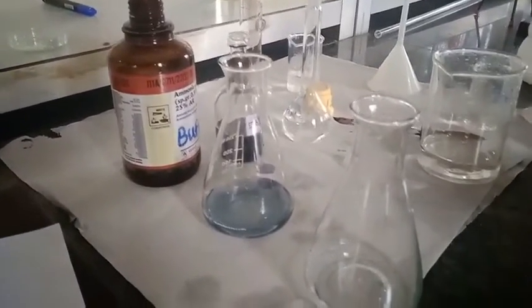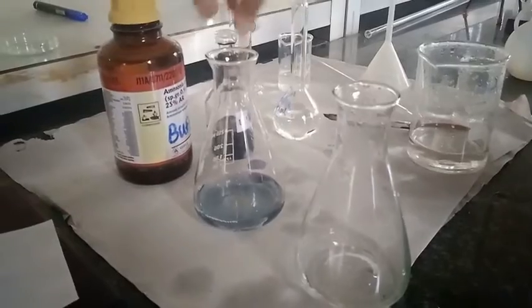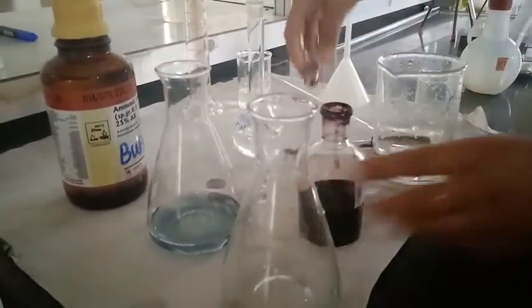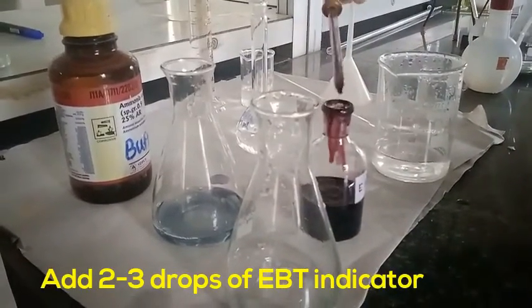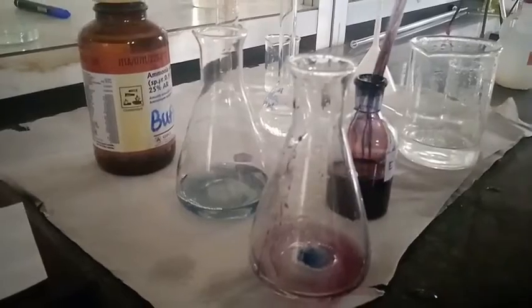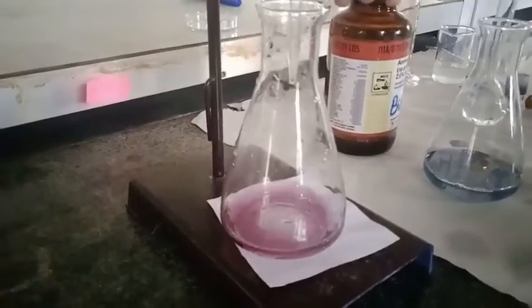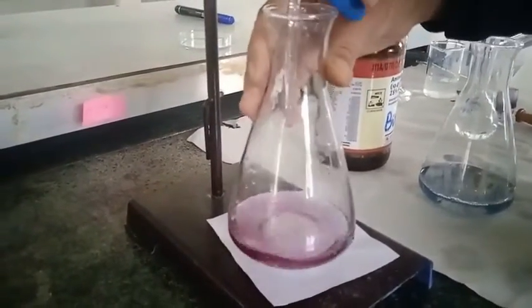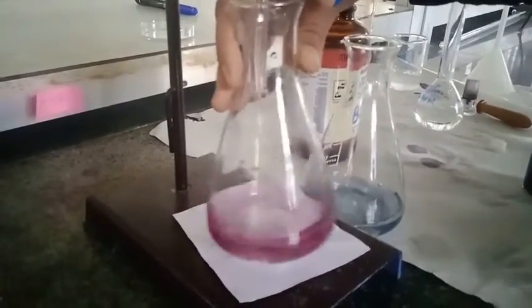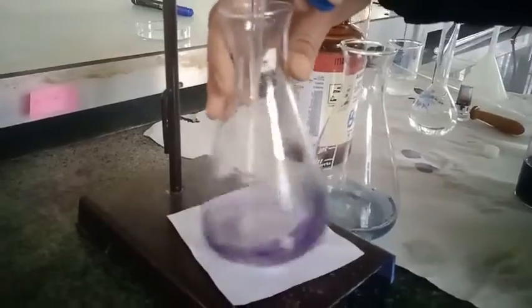In this second titration we are going to determine the permanent hardness because temporary hardness has been removed. Now I am going to add ammonia solution just to maintain the pH around 10, because this EBT indicator works in the range of 9 to 10. EDTA is acidic in nature, so the pH of the solution will go down during titration, therefore it is necessary to add a basic buffer which resists the change in pH. Now we are going to titrate it again, and I stop the titration when the colour changes.